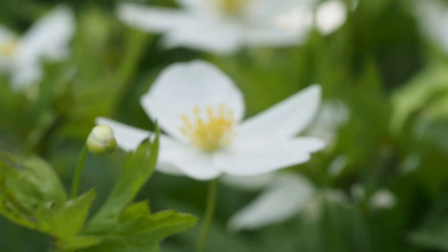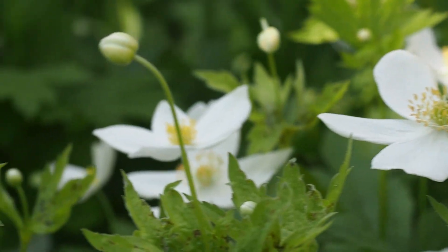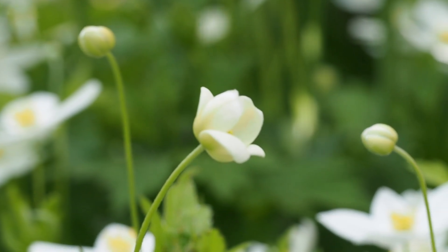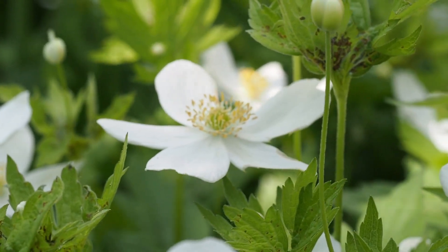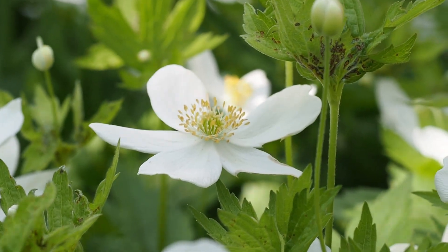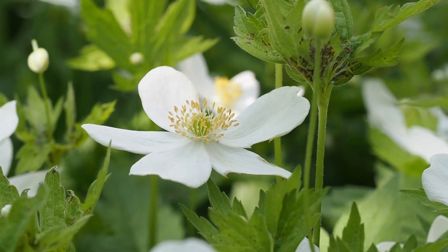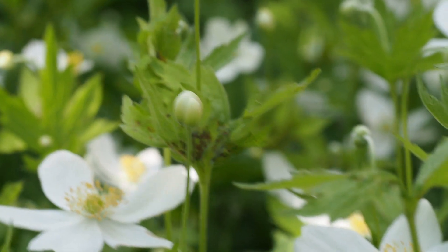Often, if there's only one series in a perianth, it's sepals and not petals. So this flower has no petals — it has petaloid sepals, five of them. It's got many pistils, many carpels, separately inserted, hypogynous flower type and ovary position, superior ovary, radial symmetry. Very typical member of the Ranunculaceae — anemone canadensis.